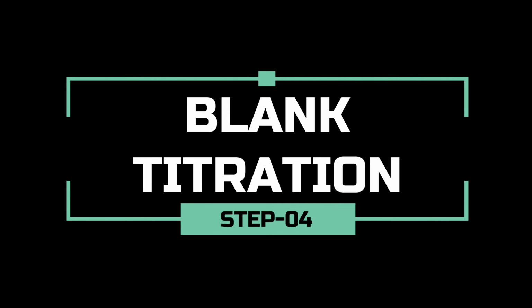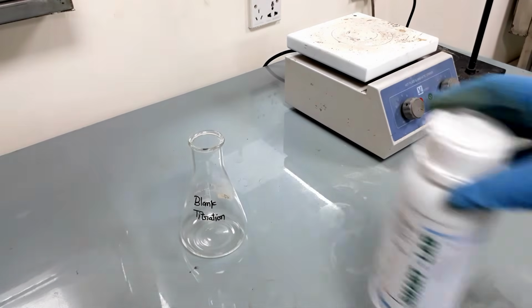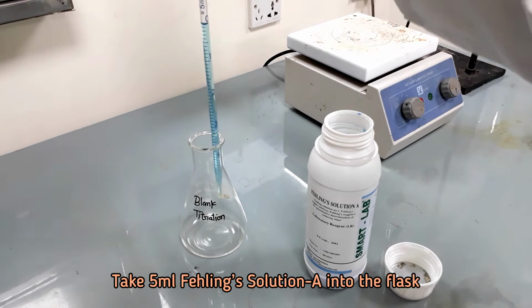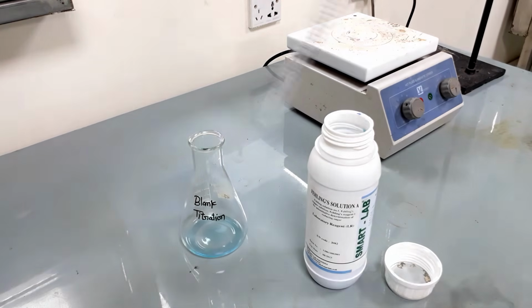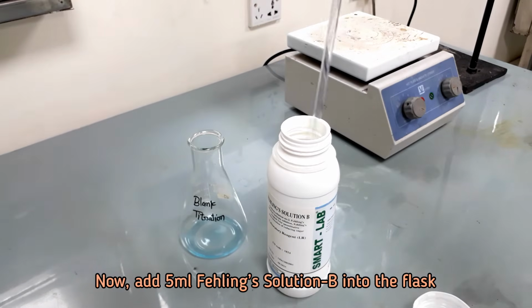In this step, we will carry out a blank titration using reagents only. Take 5 ml Fehling solution A into a clean conical flask. Now take 5 ml Fehling solution B into the flask.